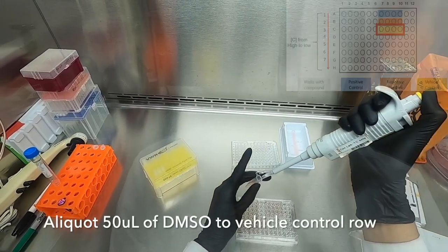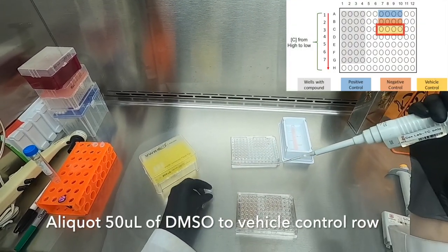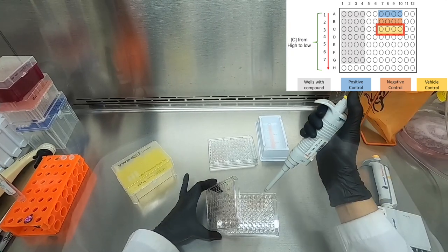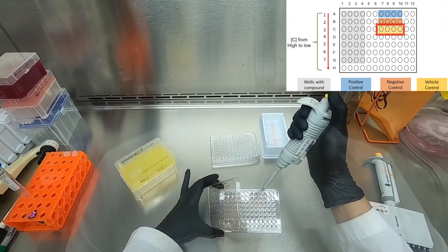To finalize our control treatments, we will be adding DMSO to the very last row of our control groups as shown in the diagram.